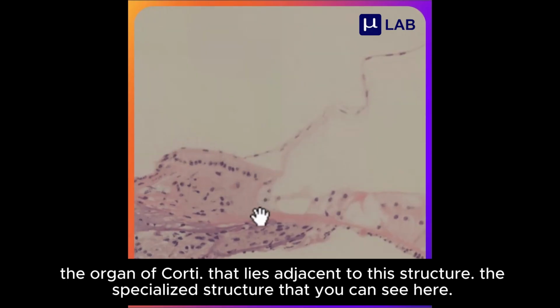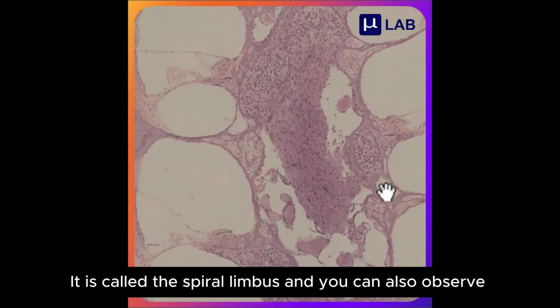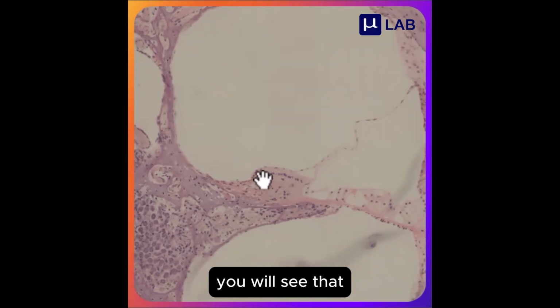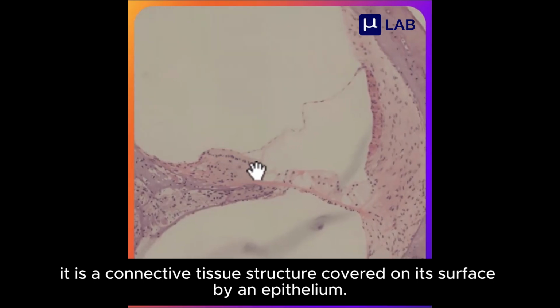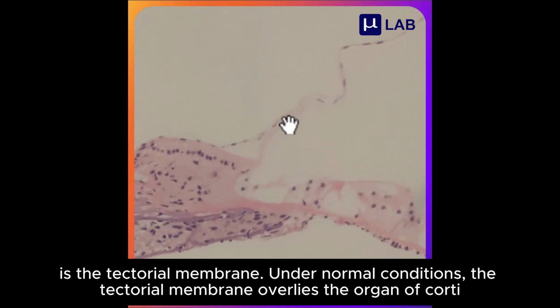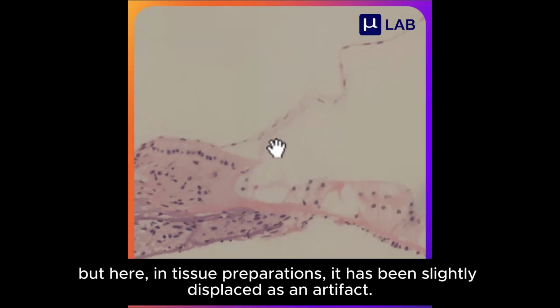It lies adjacent to a specialized structure that you can see here, called the spiral limbus, and you can also observe it in other sections. If you examine the spiral limbus at higher magnification, you will see that it is a connective tissue structure covered on its surface by an epithelium. The epithelial cells covering this surface secrete the tectorial membrane. This membrane that you see here is the tectorial membrane. Under normal conditions, the tectorial membrane overlies the organ of Corti. But here, in tissue preparations, it has been slightly displaced as an artifact.